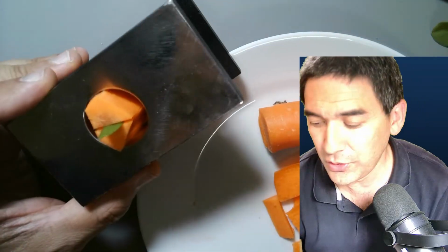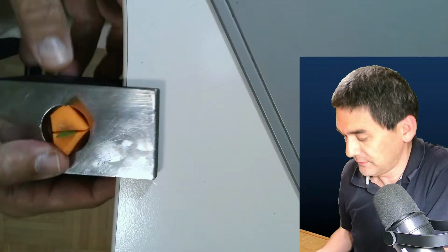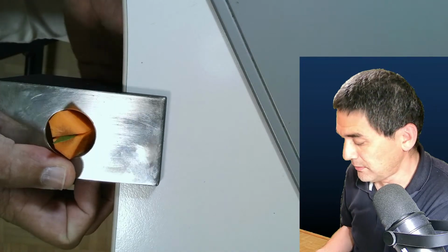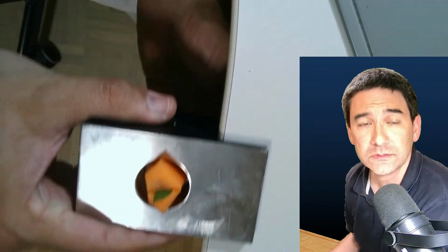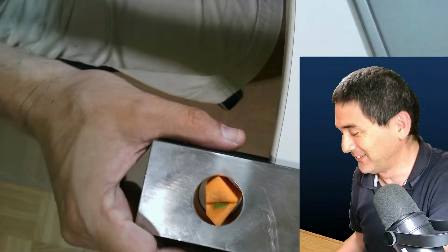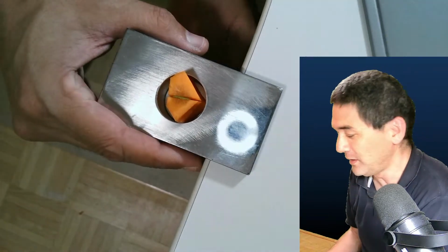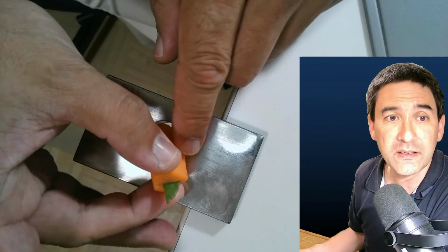Now I'm going to move this camera. I would like to show you the edge of the table. I hope this actually works. Okay, and here it is. I'm going to tighten it, and maybe move this over a little bit like this. You have to be careful that the camera doesn't fall over. I see that the USB cable could be a little bit longer as well. Okay, here you see my feet. Here we go. I think it's easier for me if I move this over like this. So you see the carrot now on top, and here inside you see the leaf.